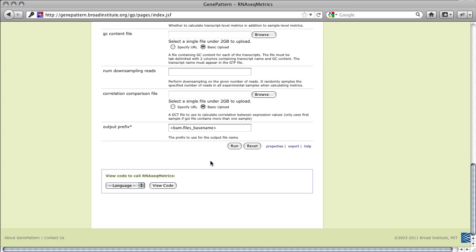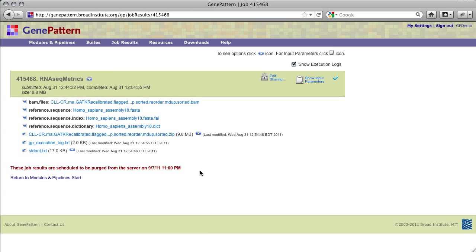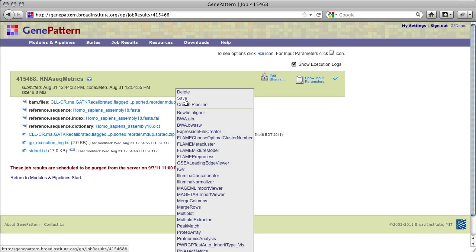Once all of the parameters have been set to our liking, we can run the module. Note that it may take minutes to hours depending on the size of your input data, the number of input files, the number and complexity of your desired output files, memory available, etc. So you may find it helpful to request an email when the job completes. When the job does complete, it will have produced a single .zip archive containing all of the metrics calculated.